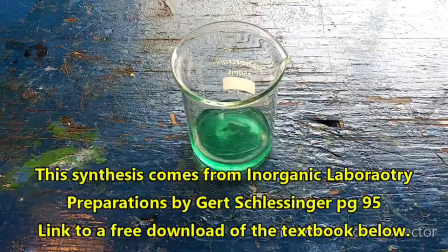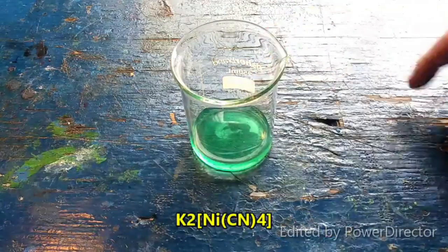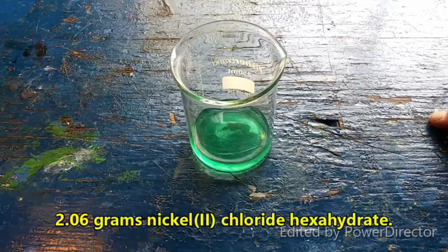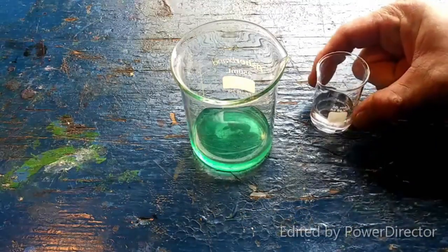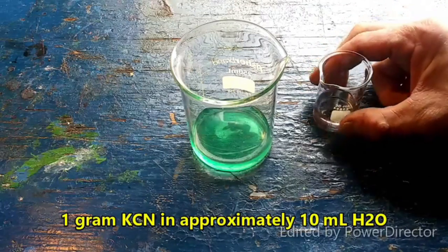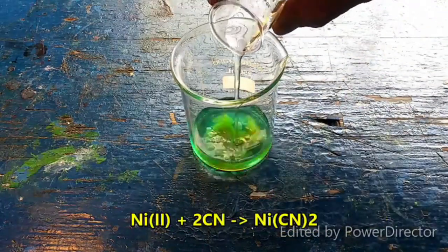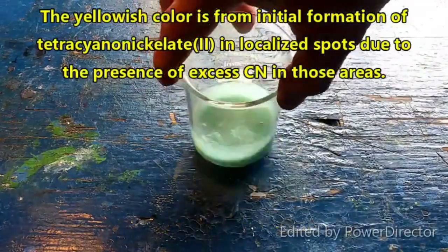Called tetracyanonickelate. Actually, potassium tetracyanonickelate. What I've got here is a solution of 2.06 grams of nickel chloride hydrate. What I've got here is 1 gram of potassium cyanide dissolved in plain water. The first step of this synthesis is to combine these two in order to precipitate out nickel cyanide.